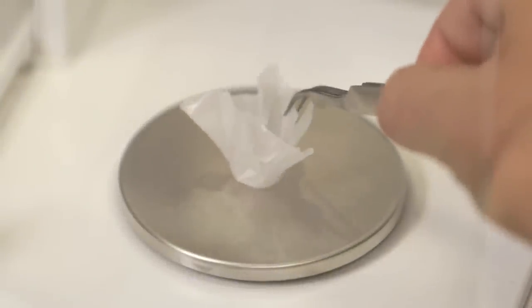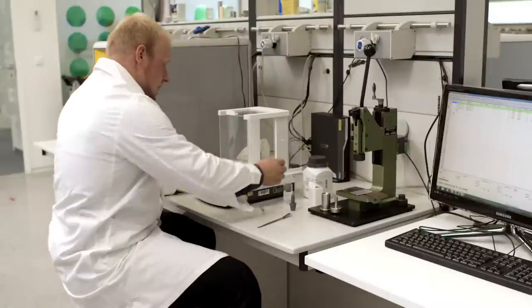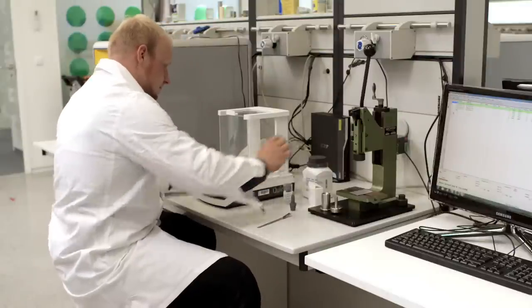Welcome! In this short video, we want to demonstrate how easy it is to weigh in organic samples for the Rapid N Exceed nitrogen protein analyzer.